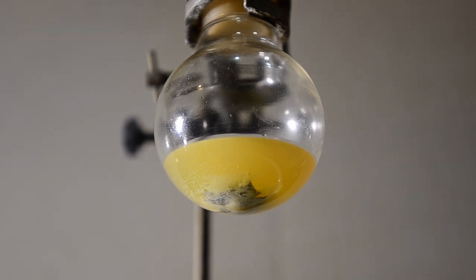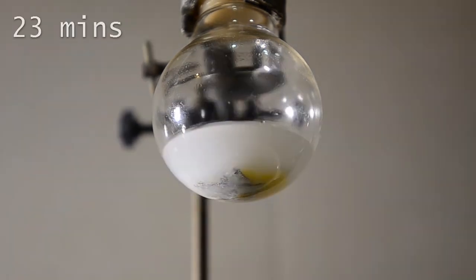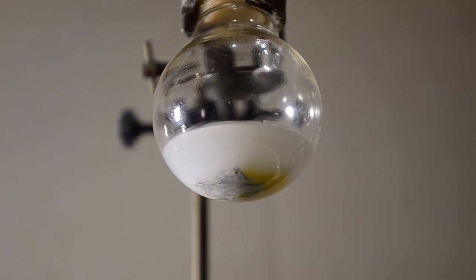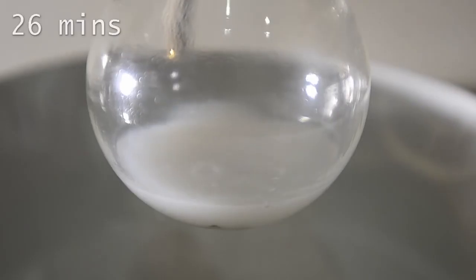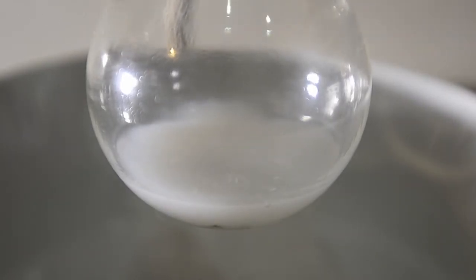Now we're 20 minutes in. At 23 minutes the yellow color of the iodine disappeared, and the reaction accelerated. Here we are 26 minutes in, and the flask is starting to get slightly warm.